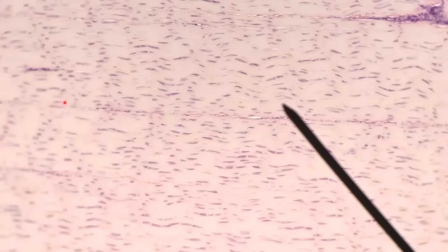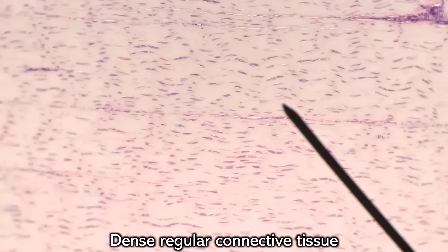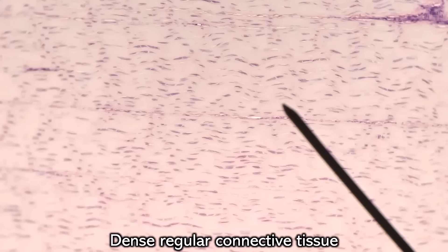This is further away than you've seen it before, but even though you can't see the individual fibers, you can kind of see the wavy pattern in the background. You've got a bunch of cells here which are smushed — fibroblasts smushed in between collagen fibers. So this is dense regular connective tissue. People sometimes will see certain types of smooth muscle and confuse it with this; I'm going to make a whole other video about that as well.